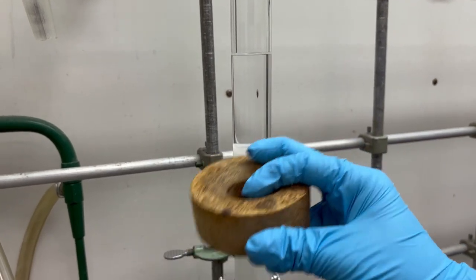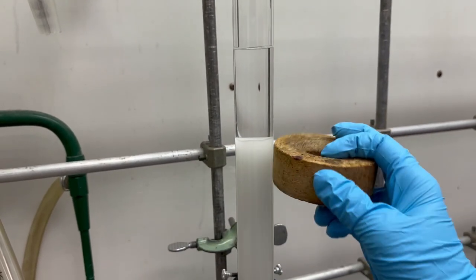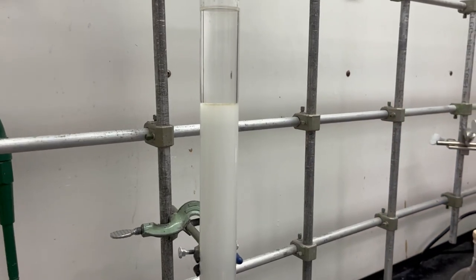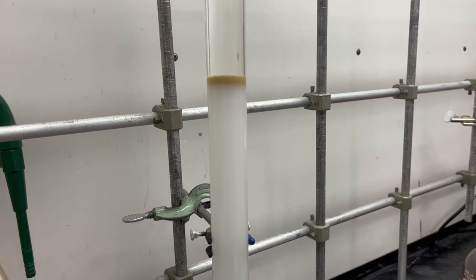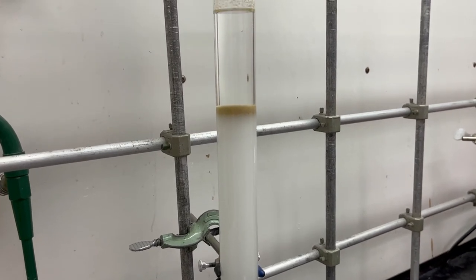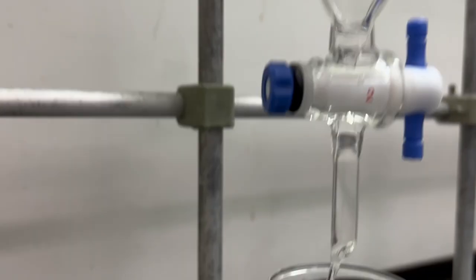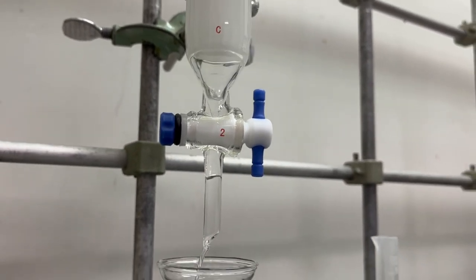Tapping slightly helps to even out the silica layer. Once it is even, a protective layer of autoclaved sand is added carefully as to protect the silica when the sample mixture is added. Again, some more solvent is passed until it just enters the sand layer.